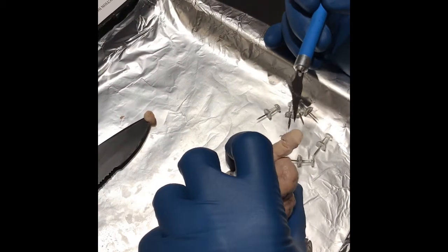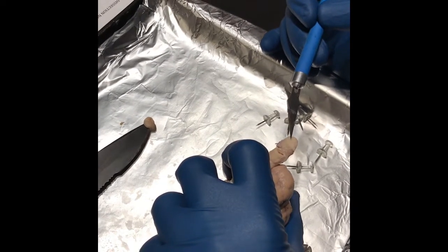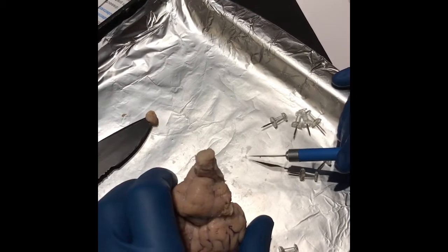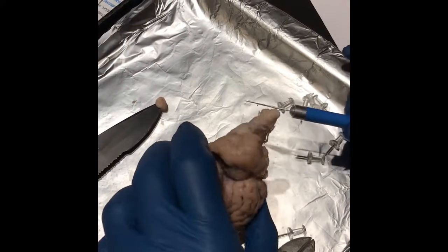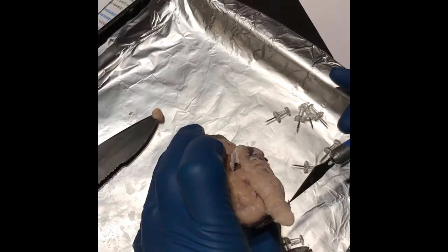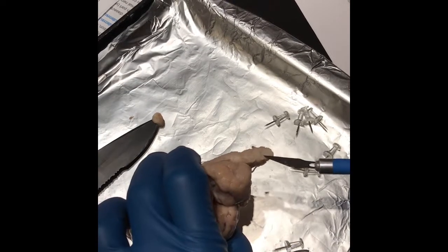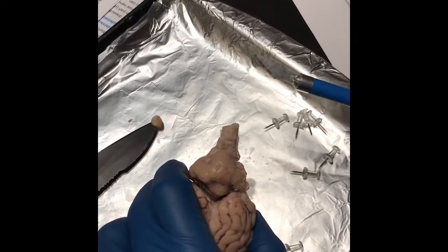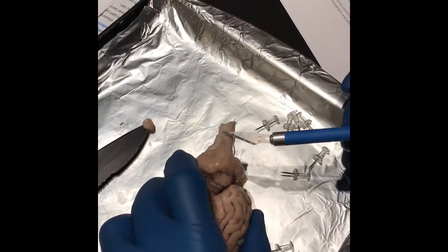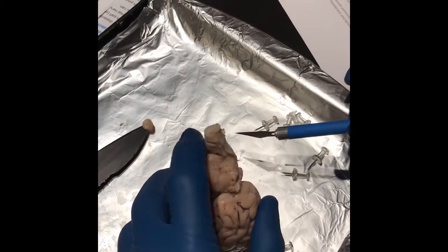And the ventral root, you can see there's a little discoloration right around here. Without the dyes that get put in, sometimes it's hard to see the difference. The dorsal root of the spinal nerve brings sensory information from the periphery to the spinal cord. And then the ventral root is the efferent. It takes the motor impulses and action commands out to the periphery.